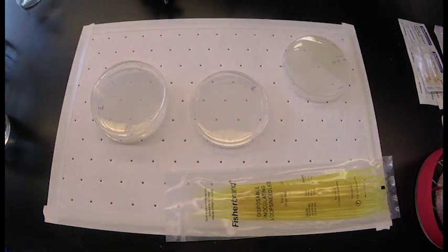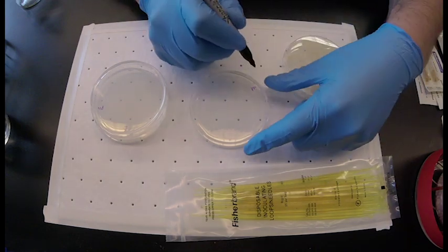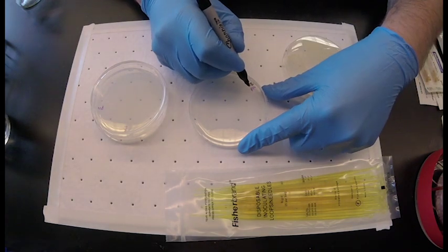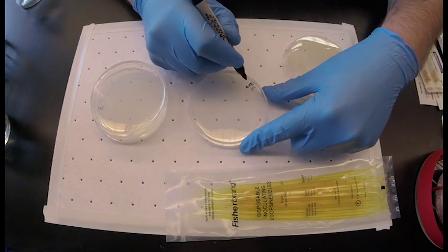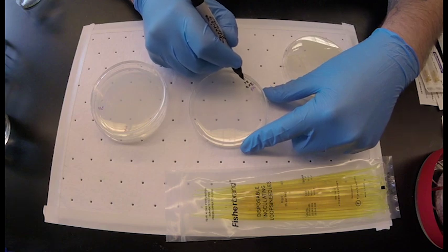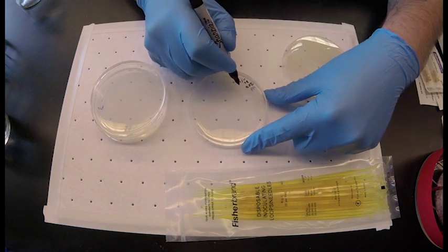Bacteria should be diluted in the third streak in order to obtain individual colonies. Once completed, label the plate with the organism, the date, and your name and put it in an incubator.